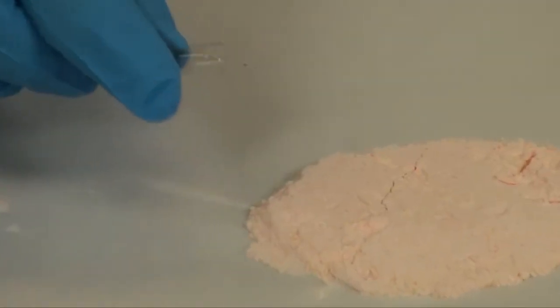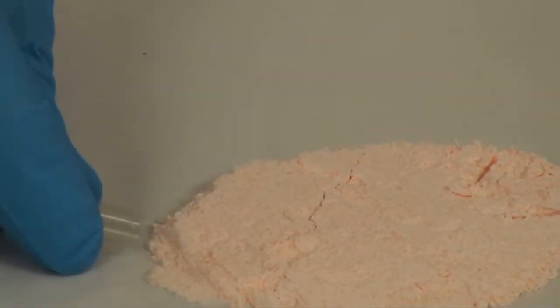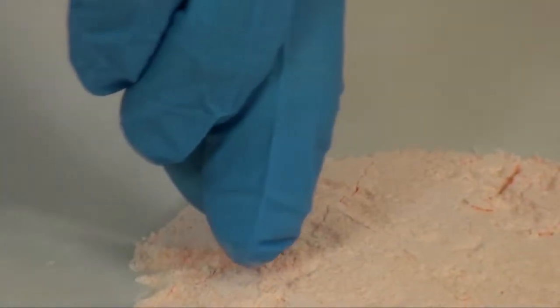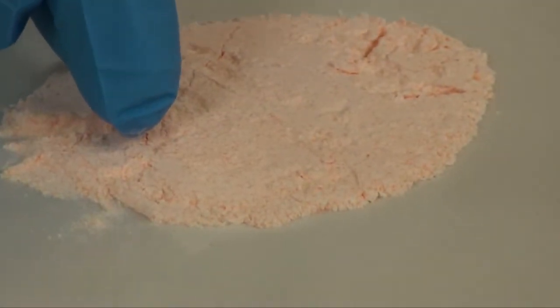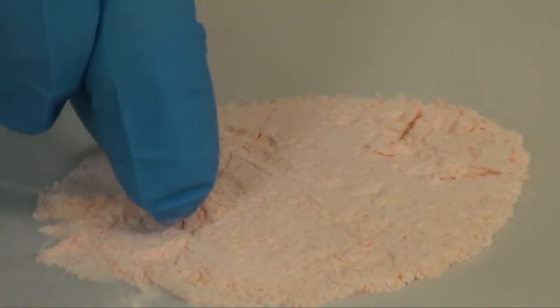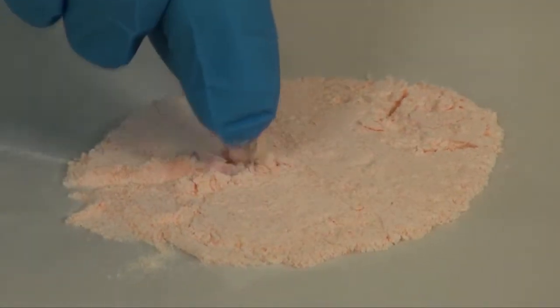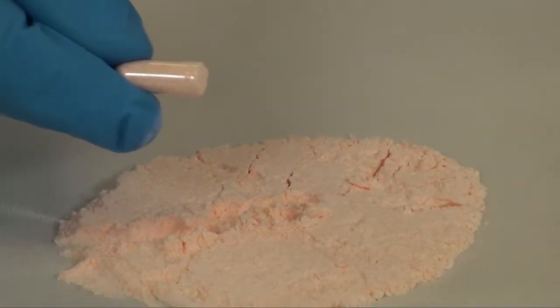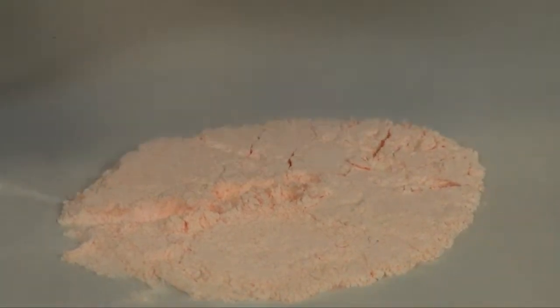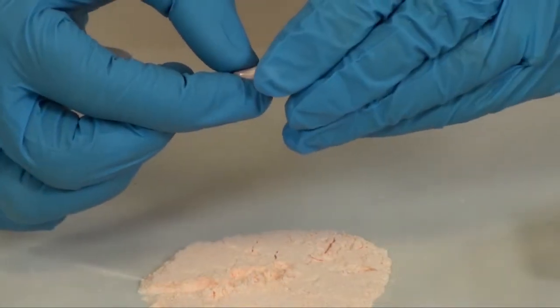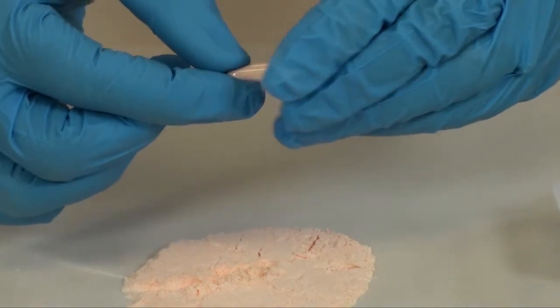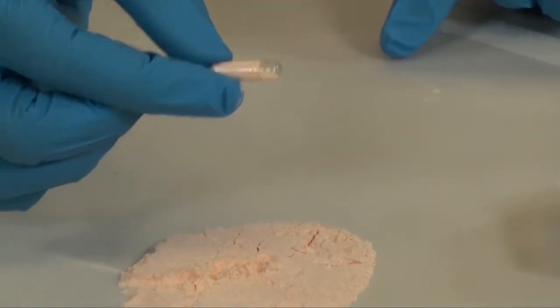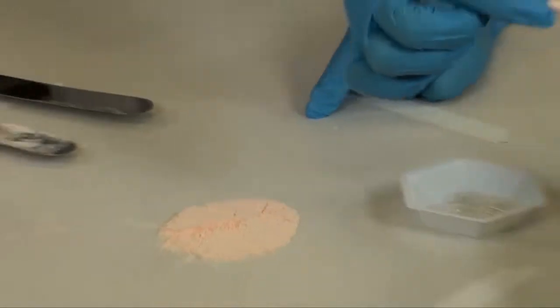Go from the side and then put the capsule in the powder and use a quick punching motion to start to fill the capsule body. Replace the cap gently onto the body, not pushing all the way, and now check your capsule for weight.